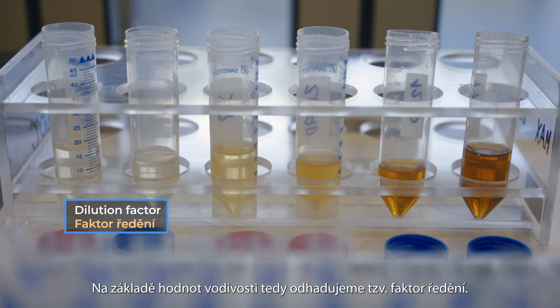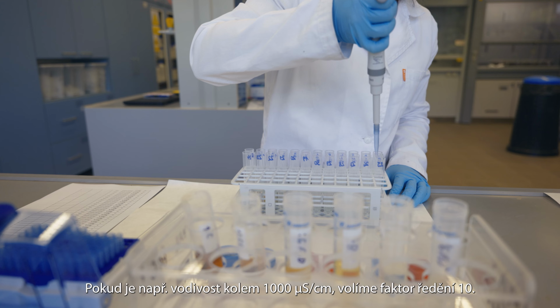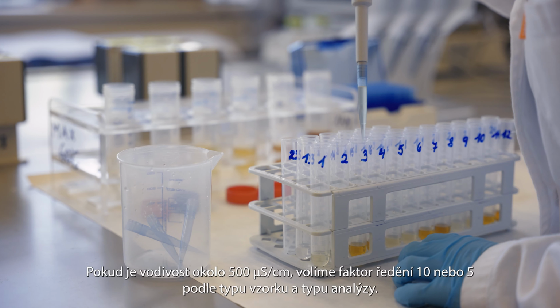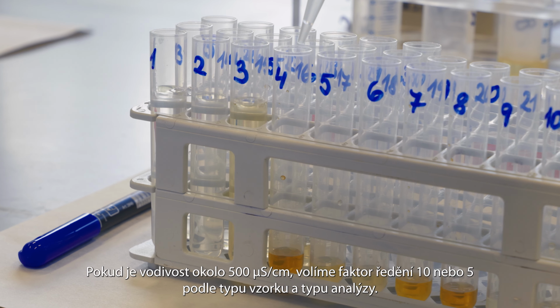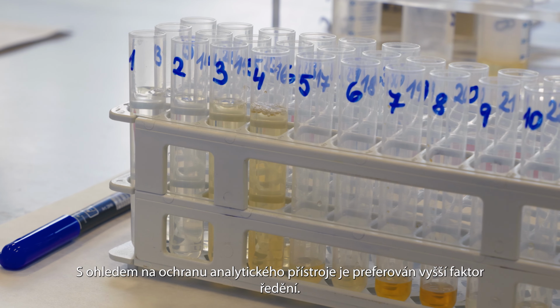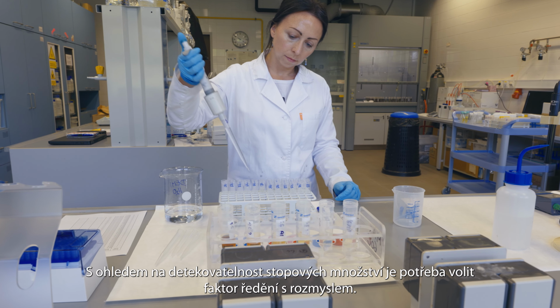Based on the conductivity values, we estimate the so-called dilution factor. For example, if the conductivity is around 1000 microsiemens per centimeter, choose a dilution factor of 10. If the conductivity is around 500 microsiemens per centimeter, choose a dilution factor of 10 or 5, depending on the type of sample and analysis. In order to protect the analytical instrument, a higher dilution factor is preferred. With respect to the detectability of trace amounts, the dilution factor should be chosen with care.